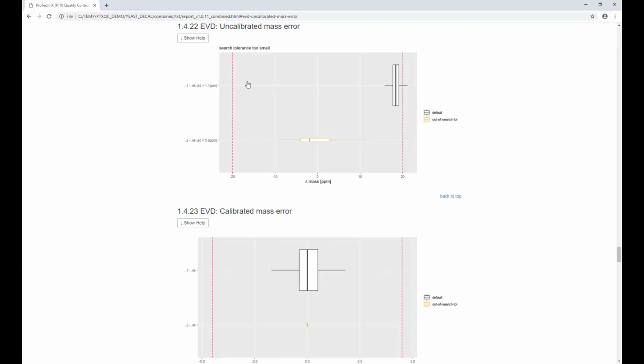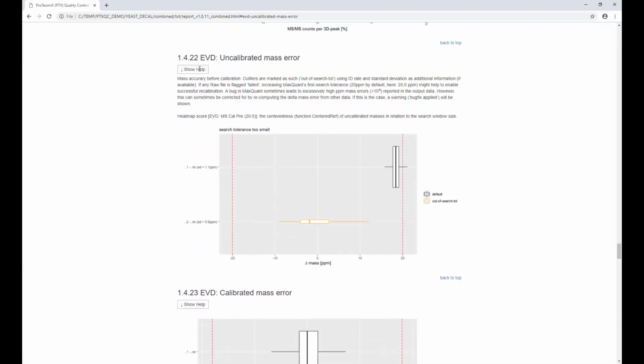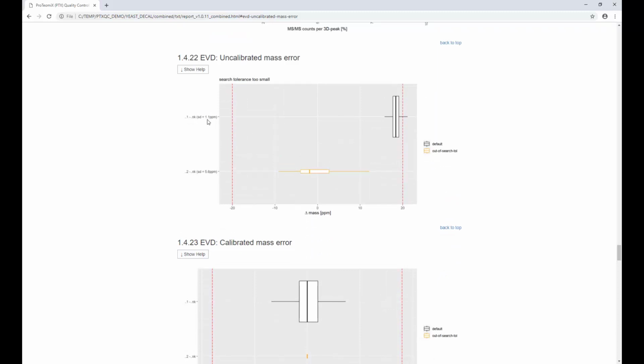So there's an uncalibrated mass error. So let's look at this. You can also have a look at the help here. Now we're going to quickly see this is our first raw file, and MaxQuant determined using a wide tolerance basically that it was decalibrated like 18 ppm. You see those thresholds here, which PTXQC derived from the mqpar file, and MaxQuant would only search plus minus 20 ppm in the first place, which means that if your sample is decalibrated even worse, it might not catch that. And so even though you're seeing for the second sample that it seems that all the masses are somewhat nicely calibrated in the middle, PTXQC looked at this data and said, well, that's probably not correct, and it labeled those as out of search tolerance.